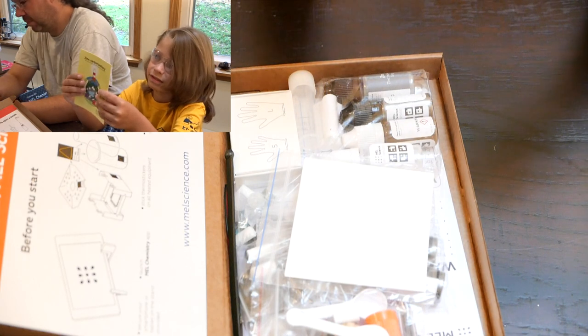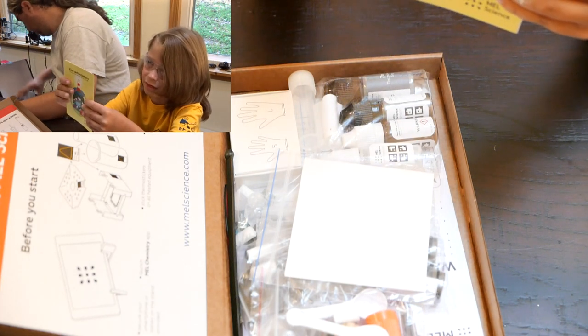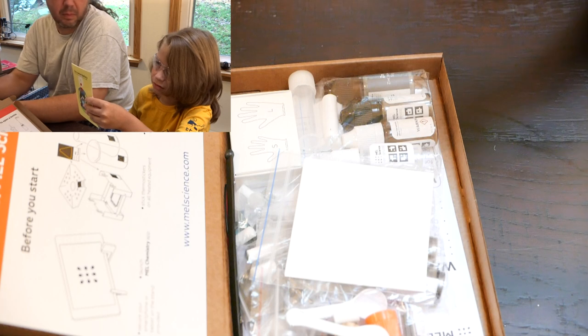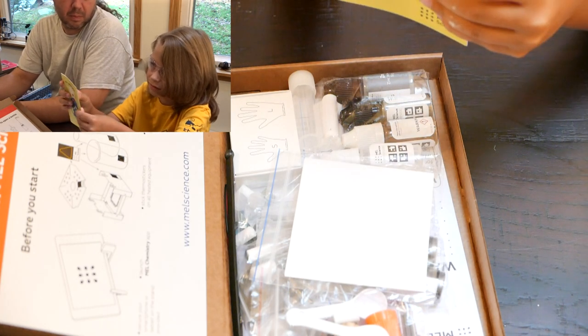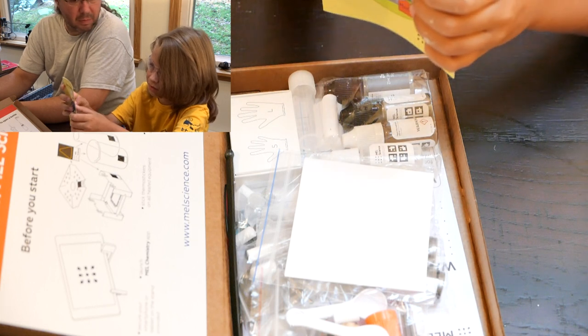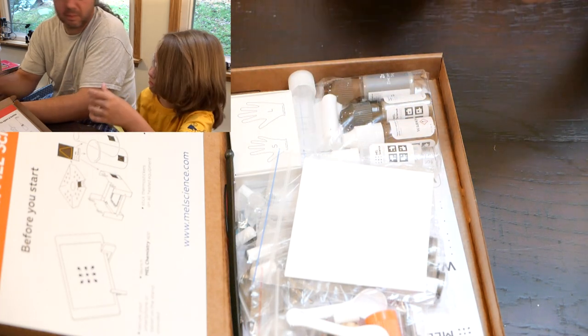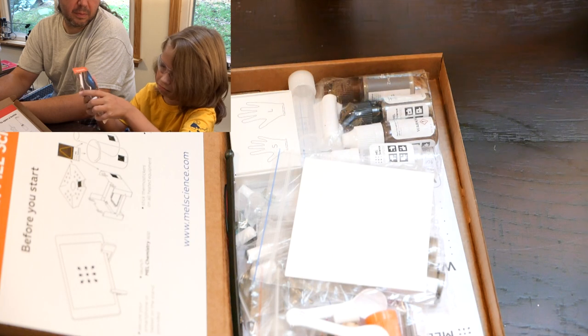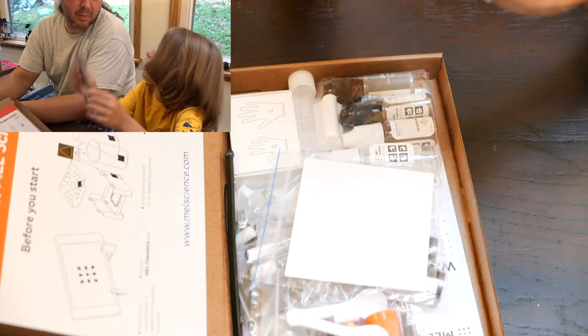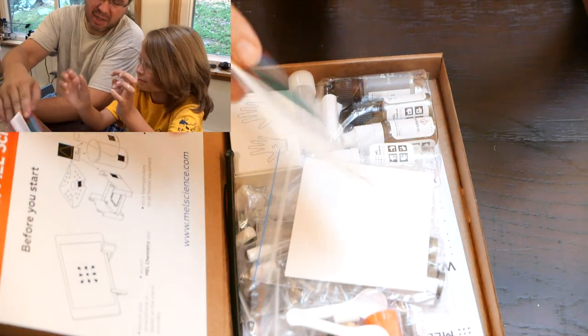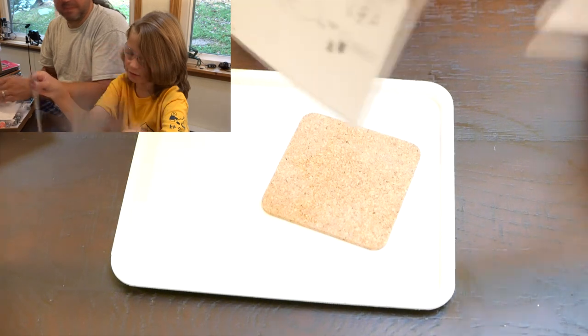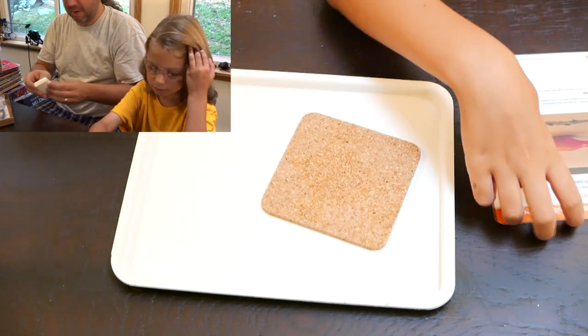Wait, this is a zinc-carbon battery after all. I'm carbon, and there's nothing about me in this story. To learn more about my role in the battery, be sure to visit zinc-carbon-battery experiment page on MEL's science website. Oh, I just said this. I will not read this whole thing. They put zinc on the Golden Gate Bridge. This one's 15 minutes. I guess we're doing this one. Yep. Glove time.